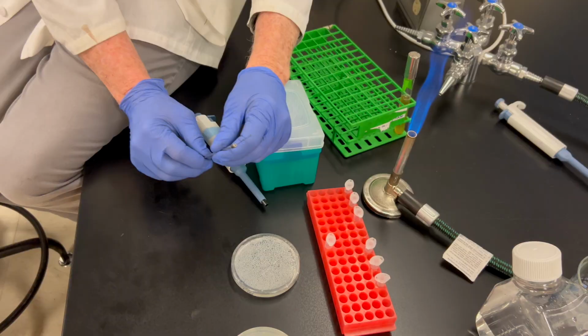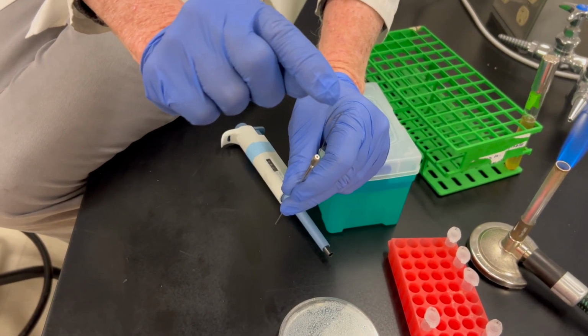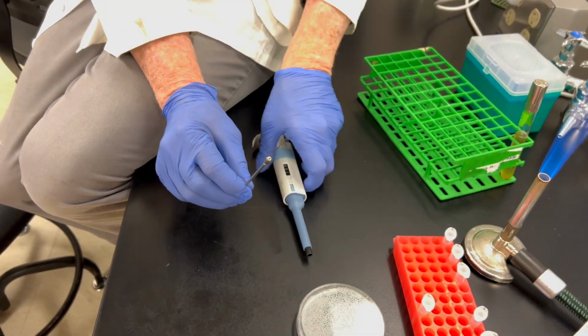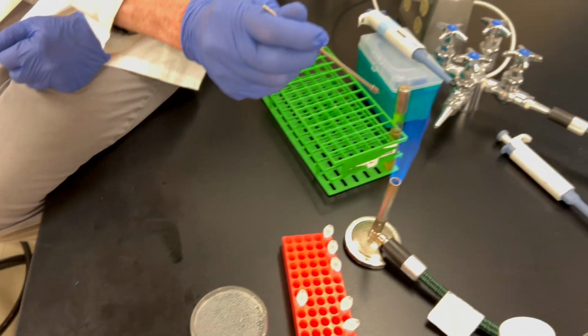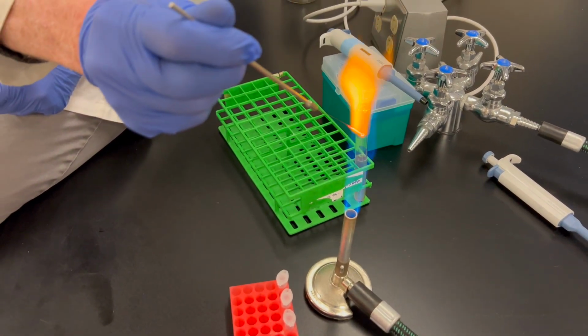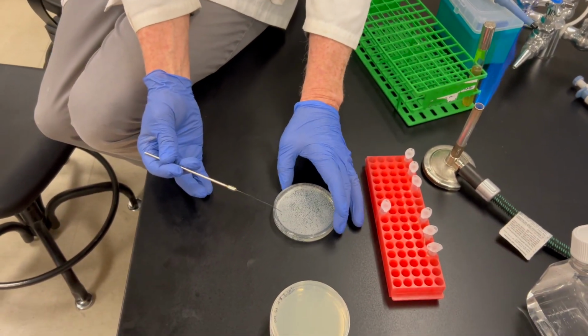And now what I want to do is take my loop. I've straightened it out, and you see we have a nice loop at the tip there. So that loop's in good shape. I'll move a couple things out of the way. I will flame the loop, going to the top of the cone, downward motion, where I get a nice arc on that flame. Now my flame is hot, so I want to be careful.